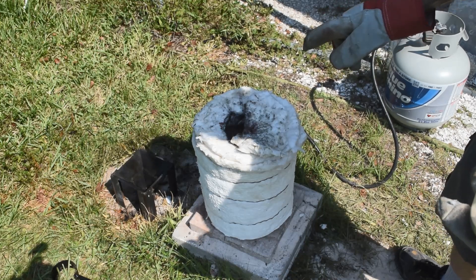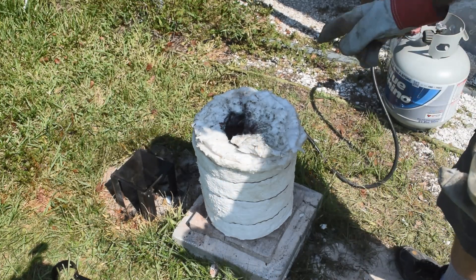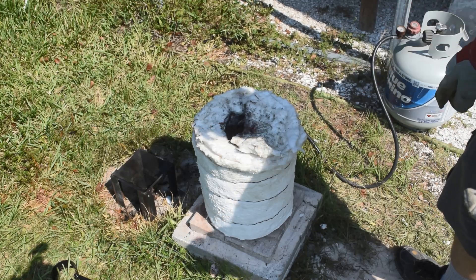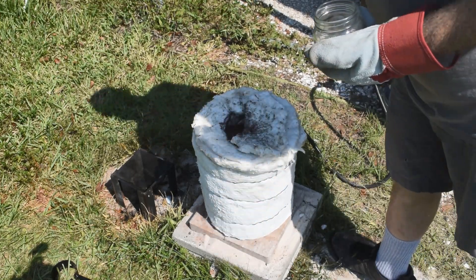All right, I'm an idiot — but there's none in there, so I just added some fine sand to provide a source of silica so it doesn't eat through my crucible. That's the purpose of that.